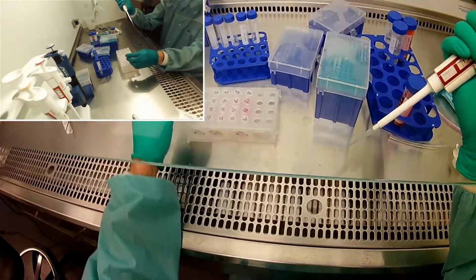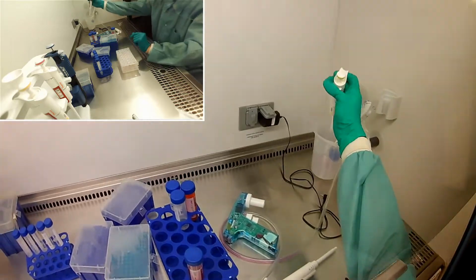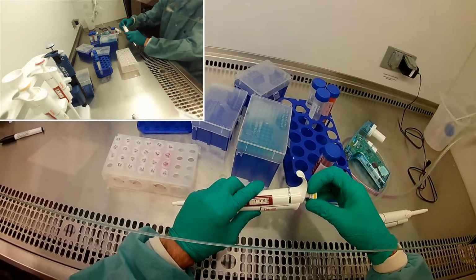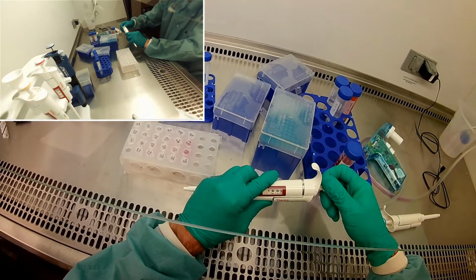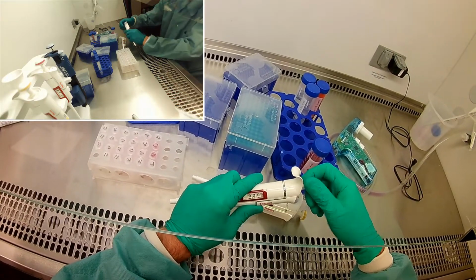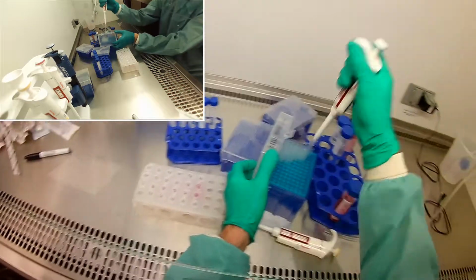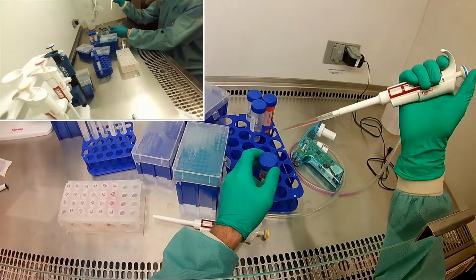Right, that gives 1 ml. Oh, that even turned a little orange, so that gives us a little color as well. That gives us 1 ml of 12% antibiotics. And then for the 8%, we're just going to do the same thing as we did for the 8% of the others, right? 920 twice. We're not going to serial dilute the 12% one, because it doesn't make an easy divide by 2 thing.